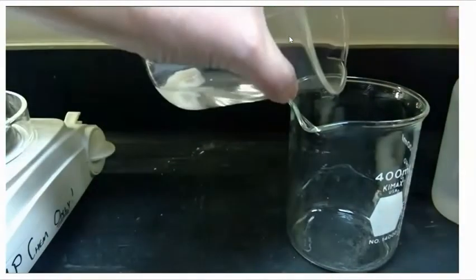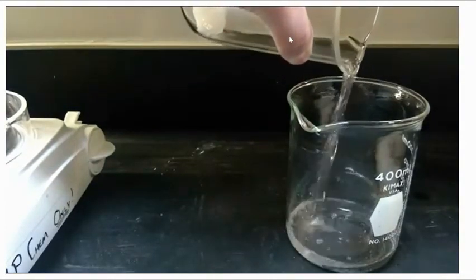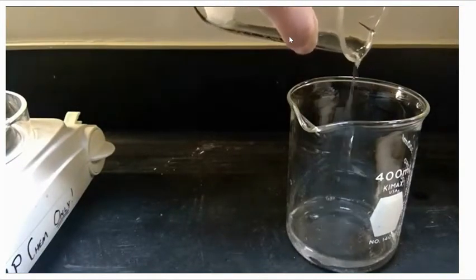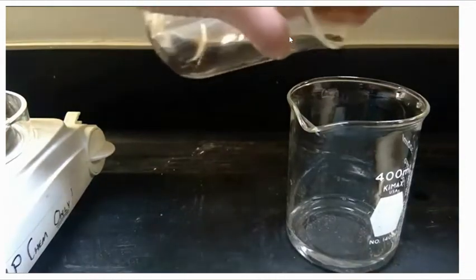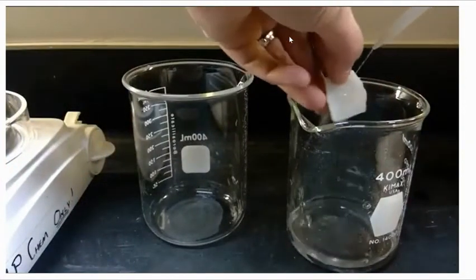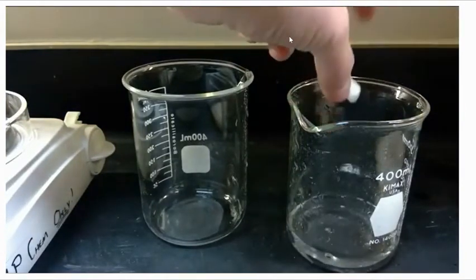And now we'll decant. We're going to let all of the liquid waste go into our other beaker, but keep the rock in our original container. And we'll let it slide into our hand so that we can capture and rinse that marble rock off. You should be able to clearly see what your limiting and excess reactant is. What was fully consumed in the experiment? What do we have extra of, unreacted?